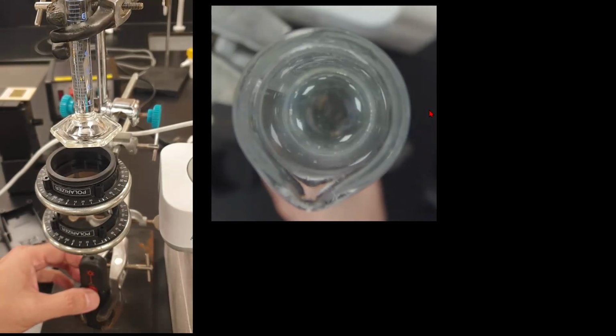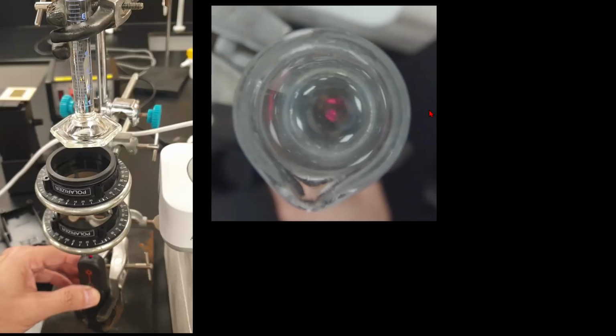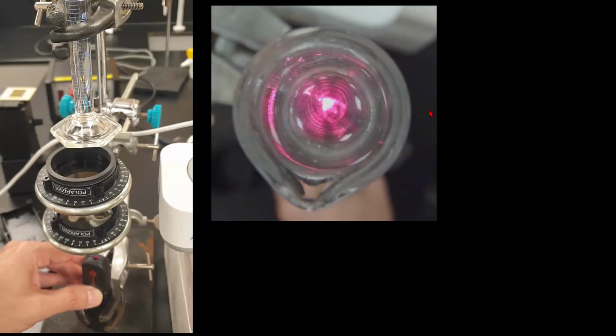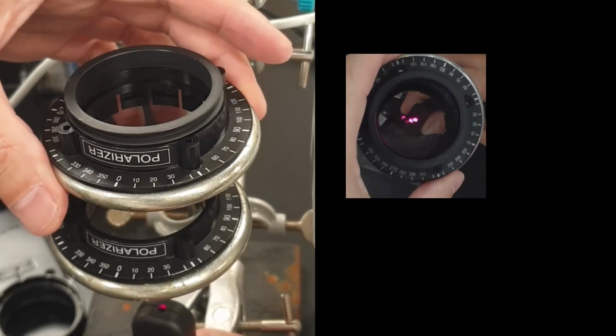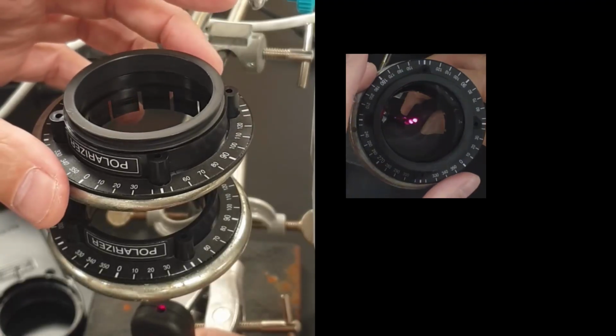And then I went and raided the physics department, well, I did for the laser as well, and got some Polaroid lenses where I can turn and see the angles. And I tried to go for a measuring cylinder this time, so that I could actually see. It's actually flat, so it's not bending the light on that side as well.